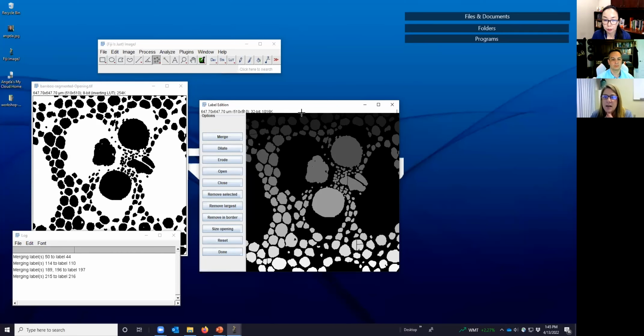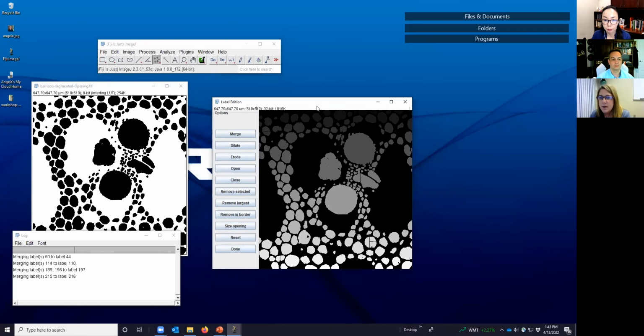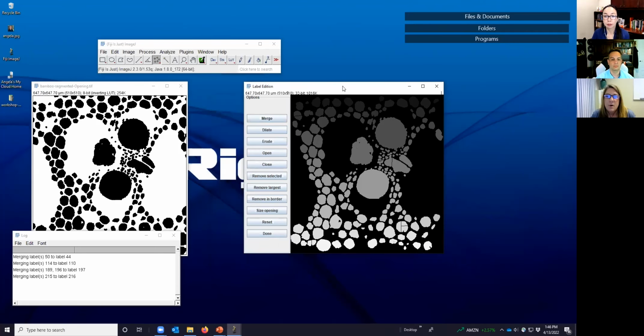All right, so what do we want to do next? Let's say we want to do some quantitative analyses, but again, we don't want our void area calculations to be biased by those that are truncated by the edge of the image. Well, you can kill borders. In this case, in the label edition window, it's called remove in border. If we just click on that button, then we see those are now gone. So now that we have merged our over-segmented objects, we can go on to do quantitative analyses.